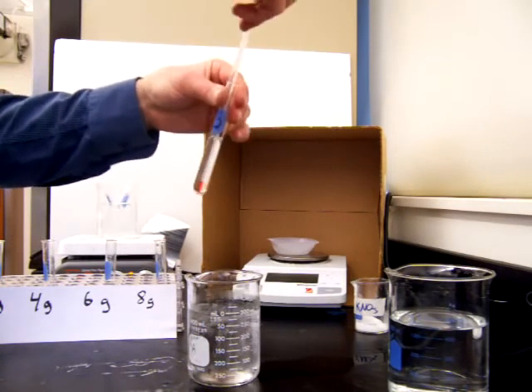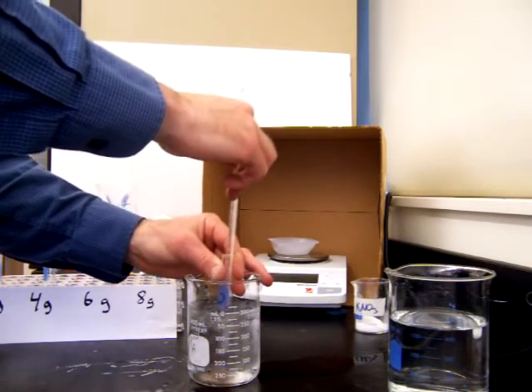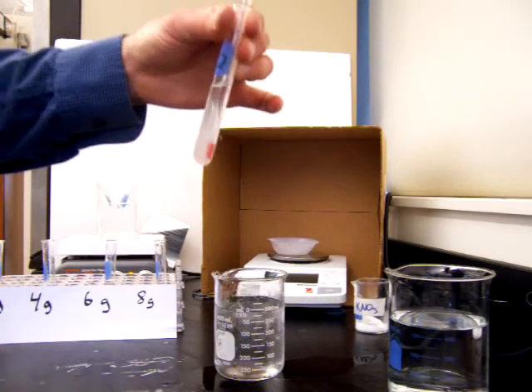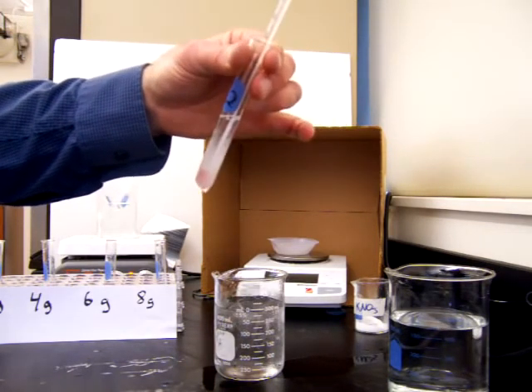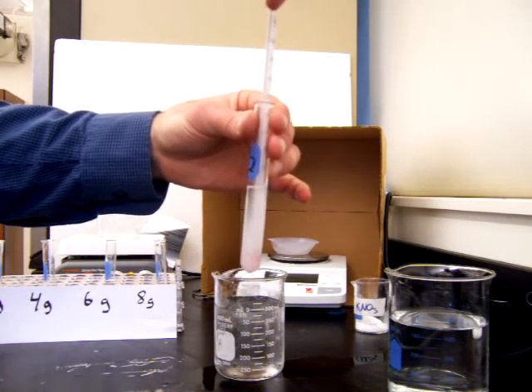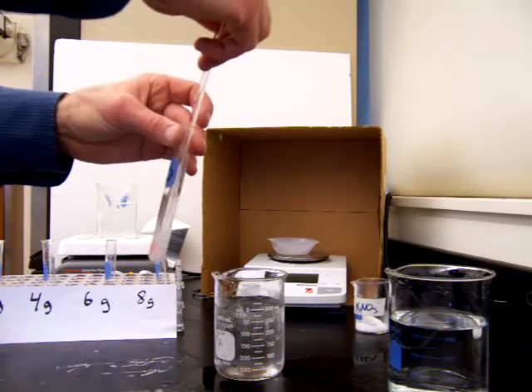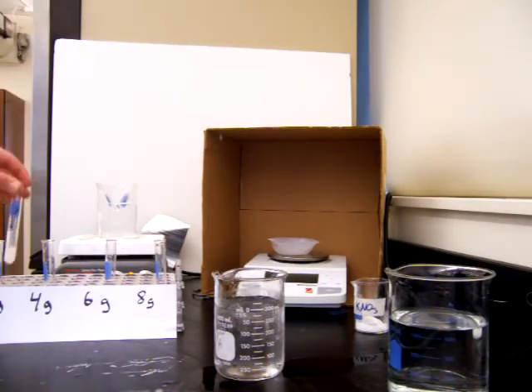So we're cooling it. We're down to about 40 degrees now. Still don't see any of the salt particles. So we'll cool it a bit more. Move it around in that solution. And here we have some salt particles starting to form now. You see it came out of solution. And we look at the temperature right now, and it's 25 degrees Celsius when those particles came back out of solution. Okay. So the saturation point for the solution with 2 grams of potassium nitrate in 5 milliliters of water was about 25 degrees Celsius. If we heated this back up, we could get the solutions to go back into solution.